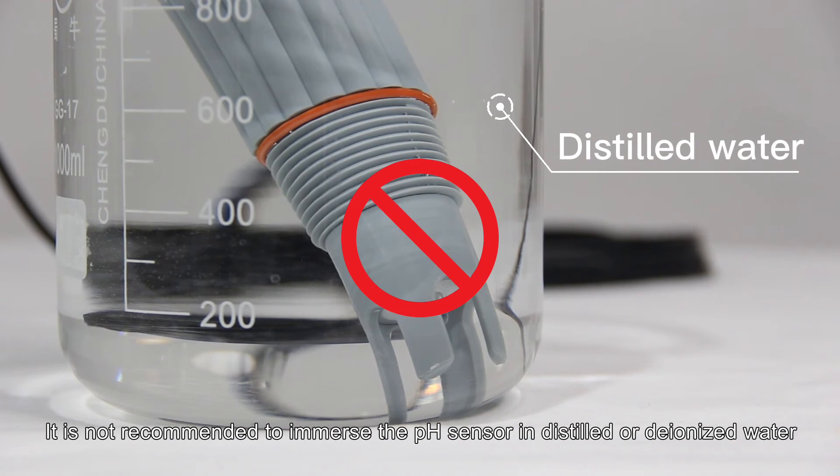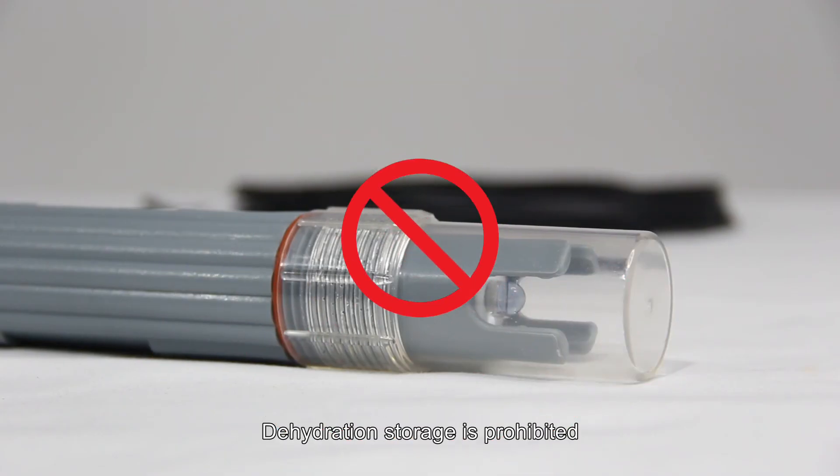It is not recommended to immerse the pH sensor in distilled or deionized water. Dehydration storage is prohibited.